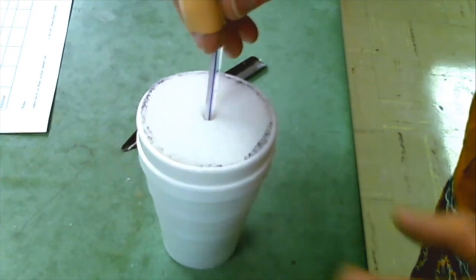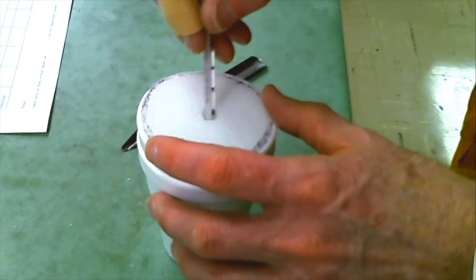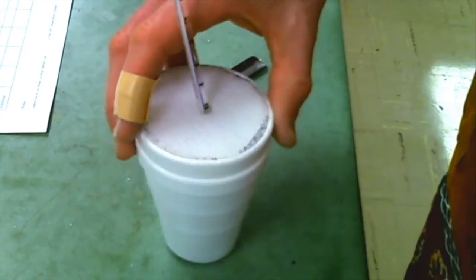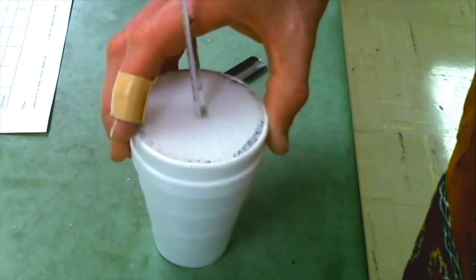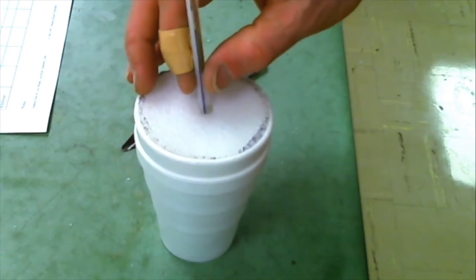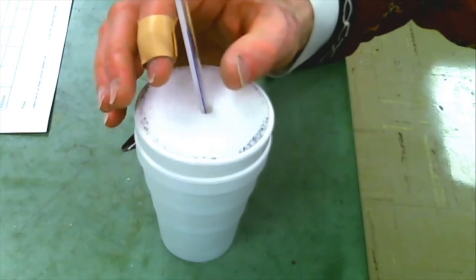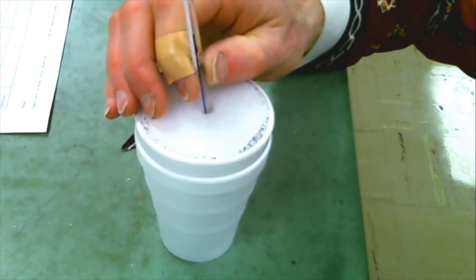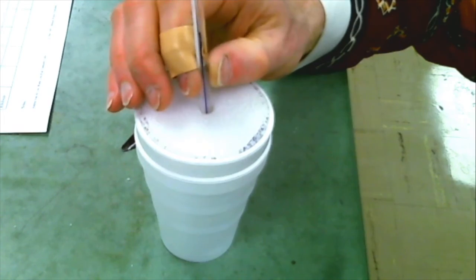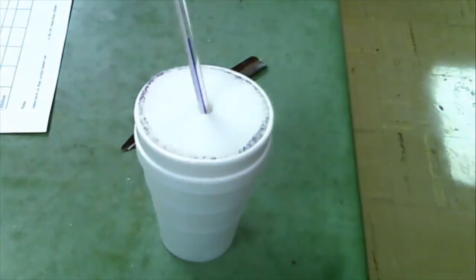Okay, this seems to not have any solid in it. I'll check after I've measured the temperature. I'm seeing 18.0 Celsius.